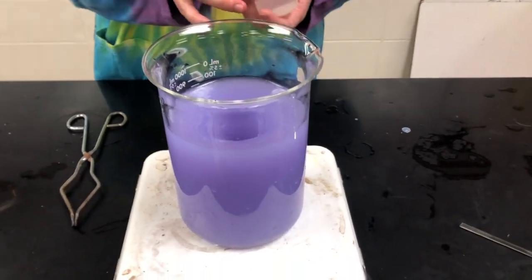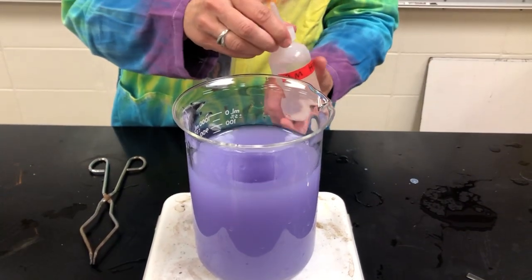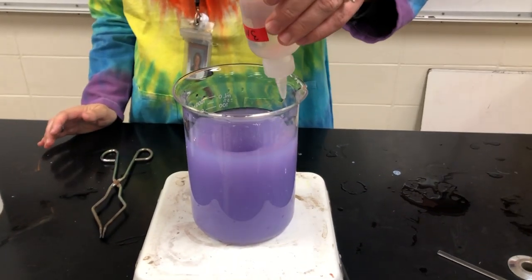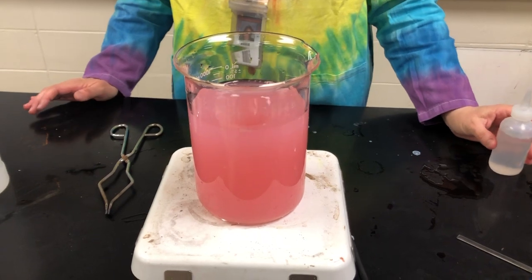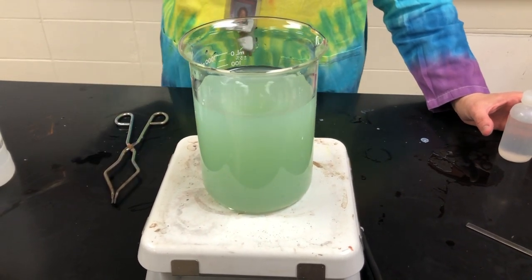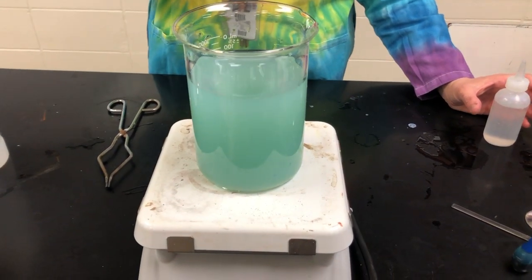This universal indicator kind of does what the food coloring does with the acids in the test tube. It should go through kind of a host of colors. Okay, so let's put some in here, and let's watch what happens. All right, so again, it's going through this host, and it's slowly getting back to that blue color.